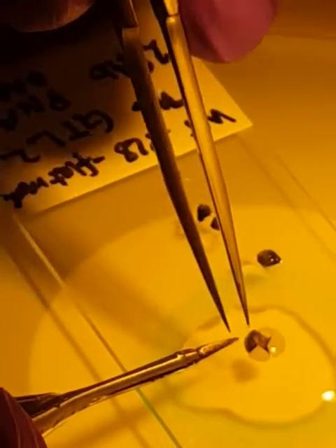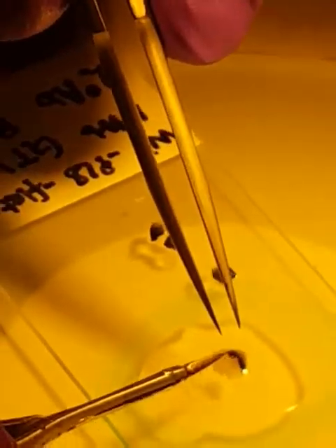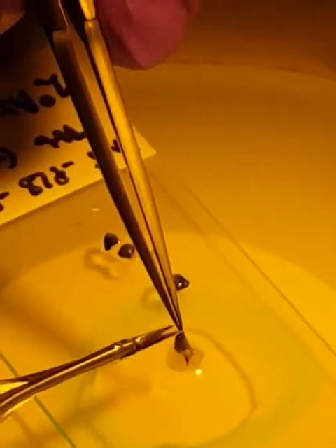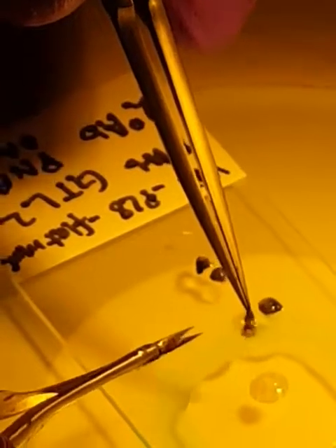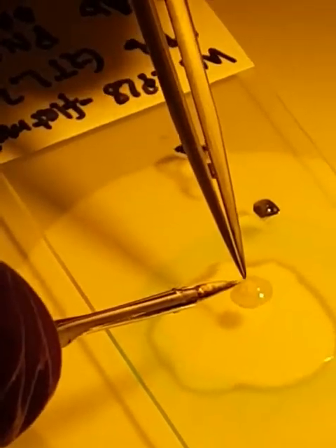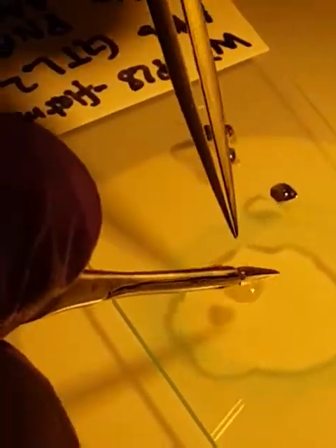This one is more attached, so I squeeze between both tissues and try to make a gap. Most of the time you need to let the PBS get in between both tissues. You can remove some debris, but I recommend not touching it much — every time you touch it, you're going to break outer segments.